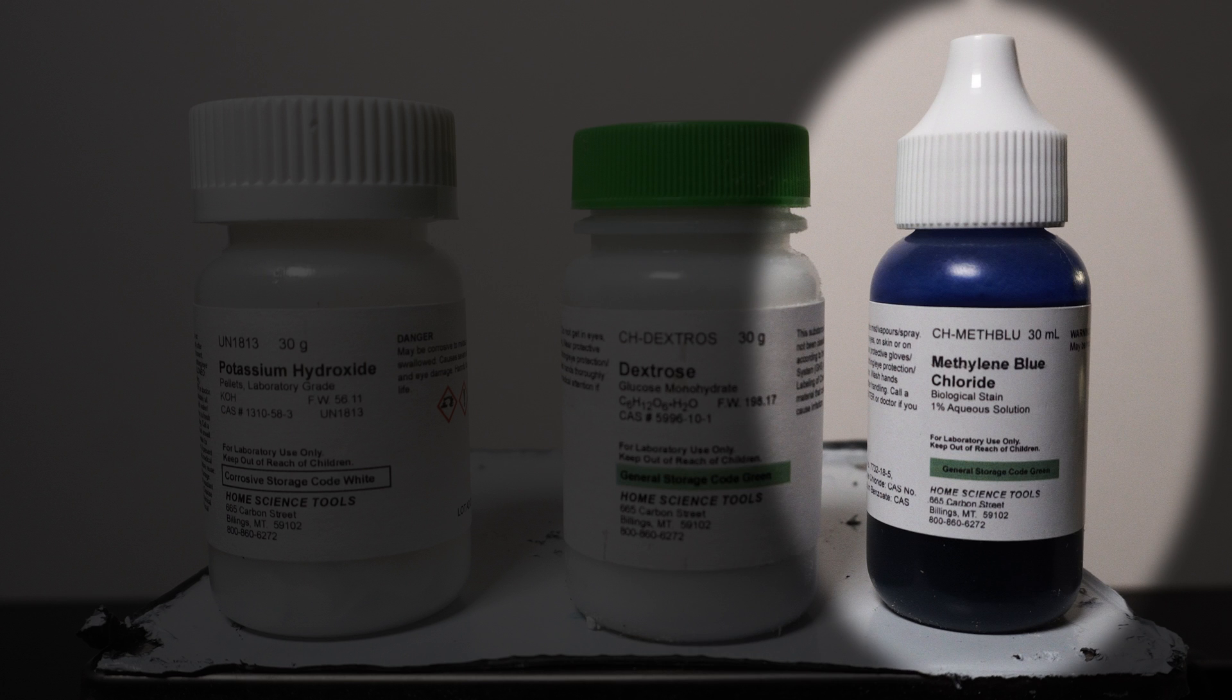And finally, we'll need a 1% solution of methylene blue. Methylene blue has a rich history of medicinal uses, though most commonly today it is used as a stain or dye for x-rays and during surgeries.